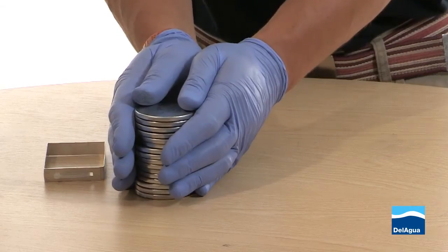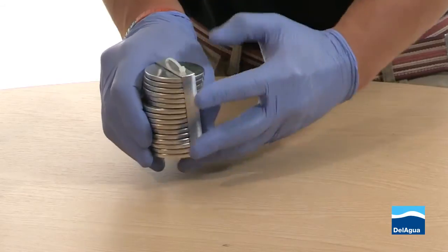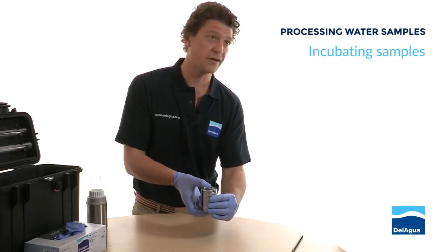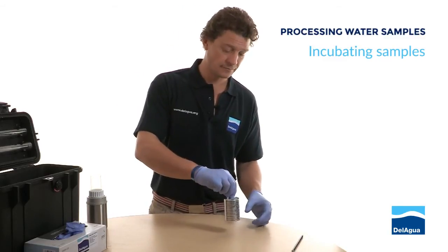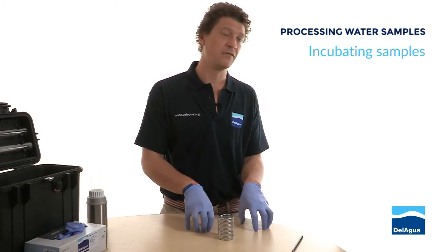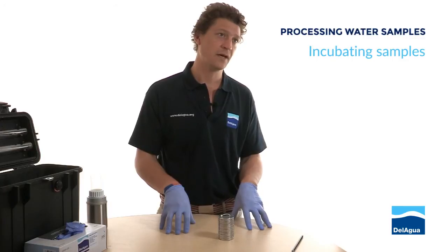Try and keep the stack of petri dishes as upright as you can and gently slide them into the strap. Don't force the petri dishes through the strap - you'll end up catching edges around the side of the petri dish and tearing them, which makes them very difficult to get into the incubator chamber. I notice you've got empty ones in there as well - why is that? Because the incubator unit works on conduction of heat rather than convection of heat. If there weren't the empty petri dishes in, you wouldn't get an even distribution of heat through the incubation chamber.